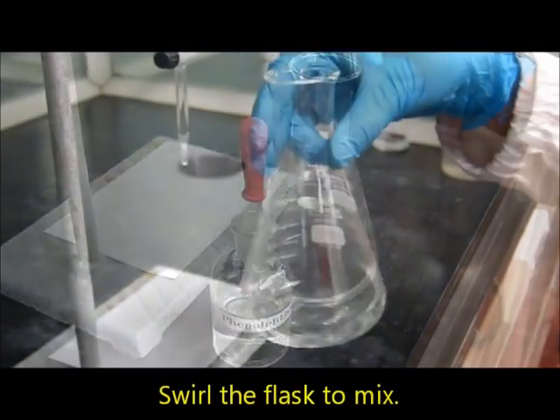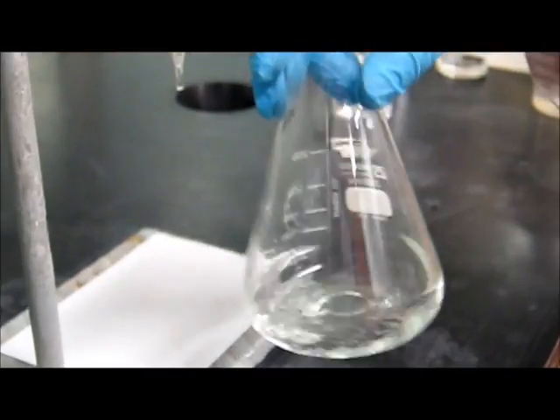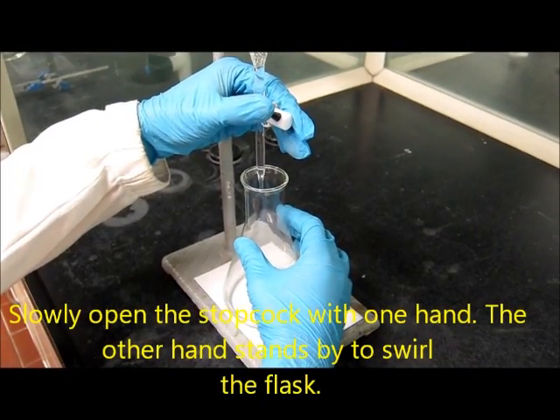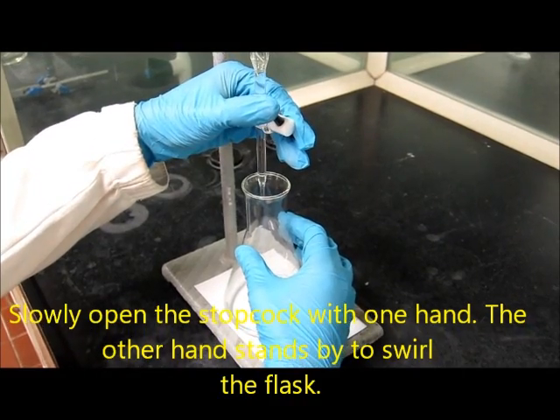Next swirl the flask well. Then slowly open the stopcock with one hand. The other hand stands by to swirl the flask.